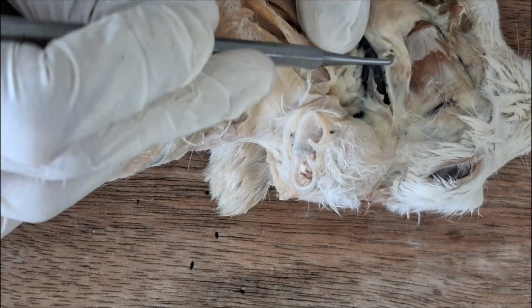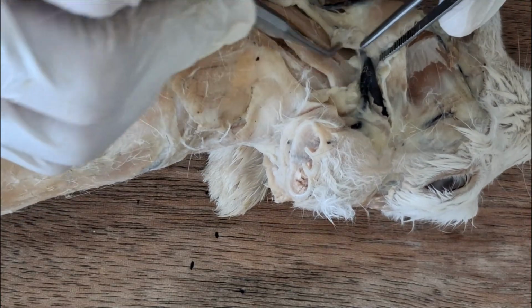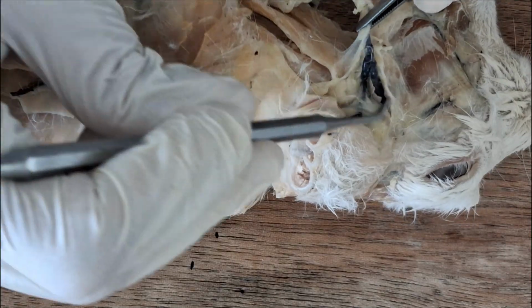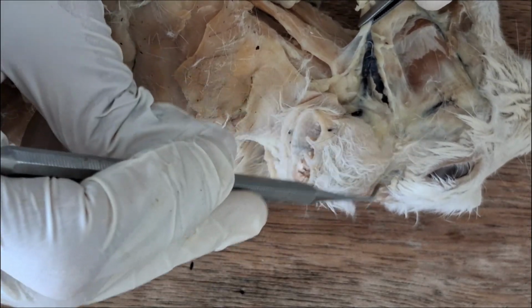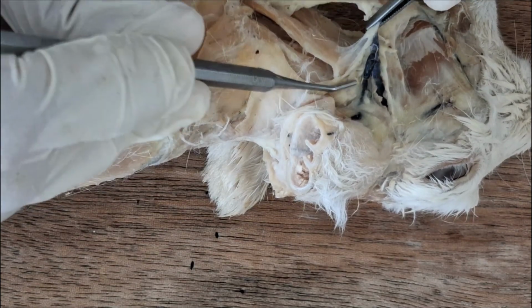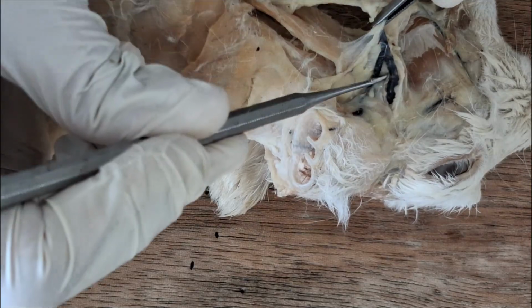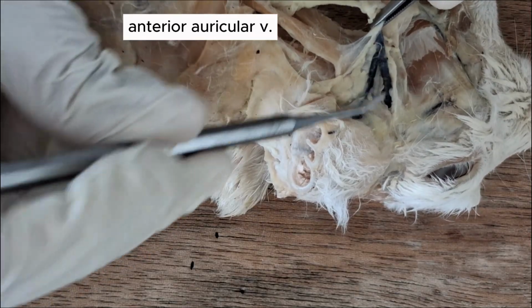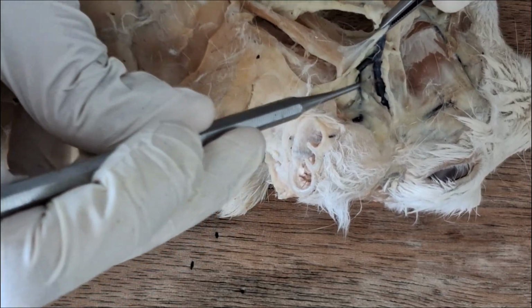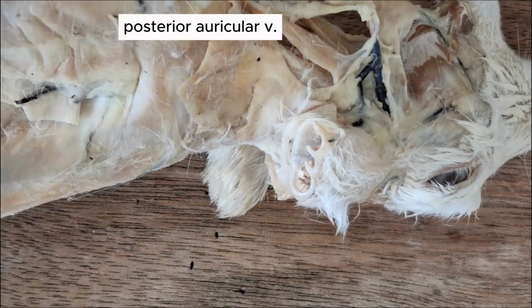And then the posterior facial vein is formed by two tributaries. One going on the front side of the ear and the other one going behind the ear. So on the front side is the anterior auricular, and then the one behind is the posterior auricular vein.